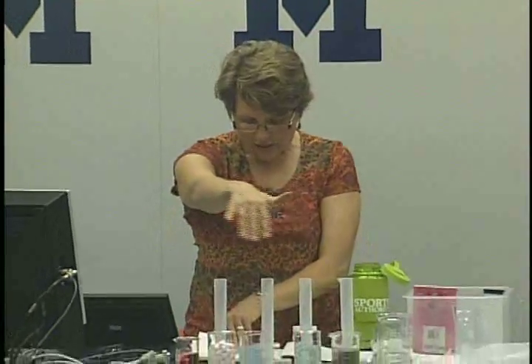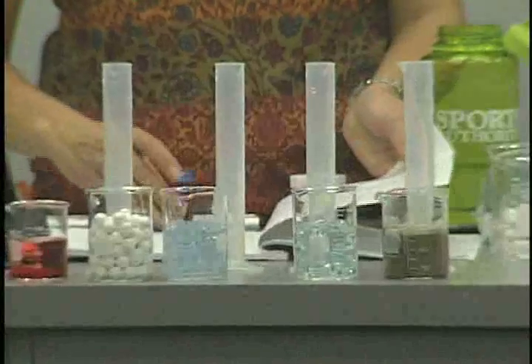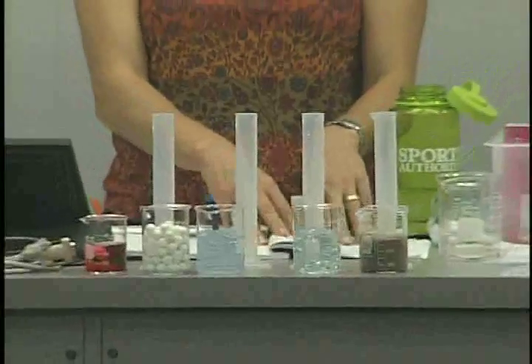where we need to answer the question, is there evidence of forces between particles? Okay, so remember in experiment 1, our question, is there evidence of particle motion in liquids? And I'm picking this up now to show you that the red is completely evenly distributed throughout this whole beaker. So that was the first question. The second question, is there space between particles of solids? And then you followed that with your simulator, which you've now completed. And now we're on experiment 4. Is there evidence of forces between particles?